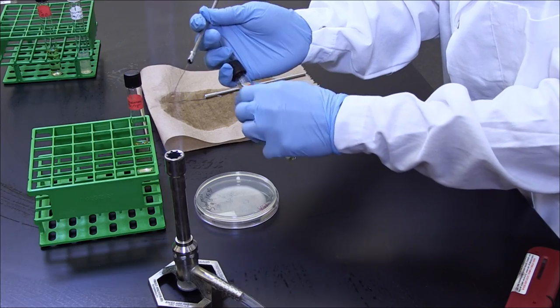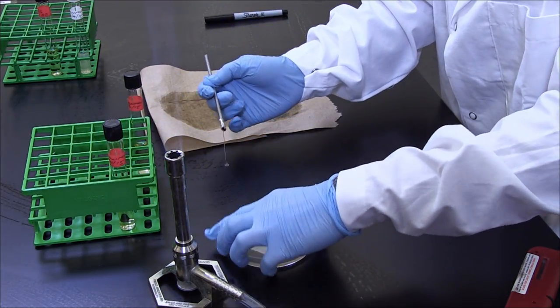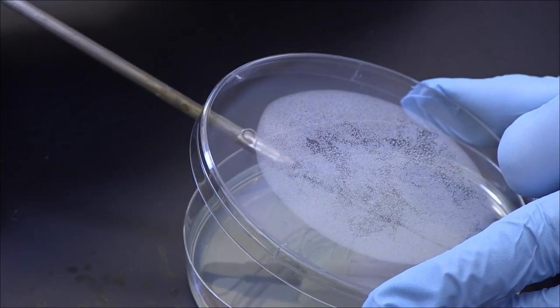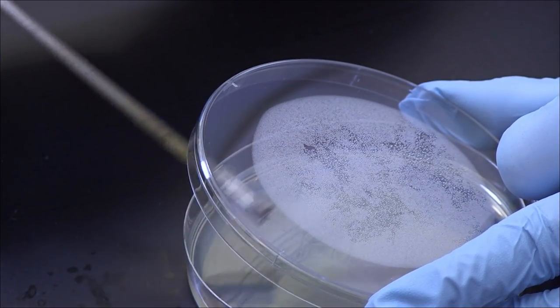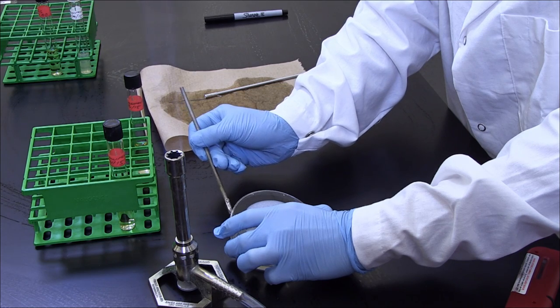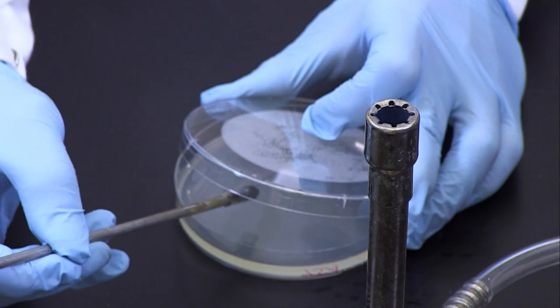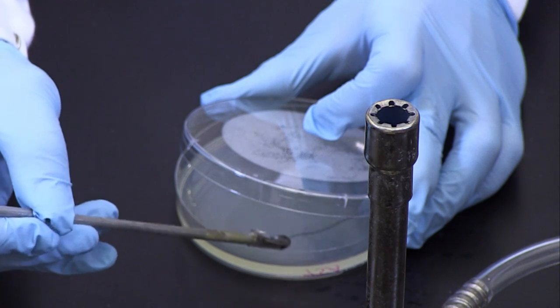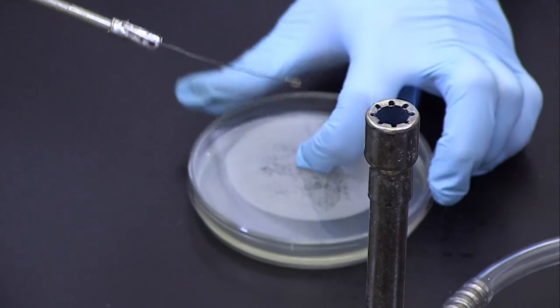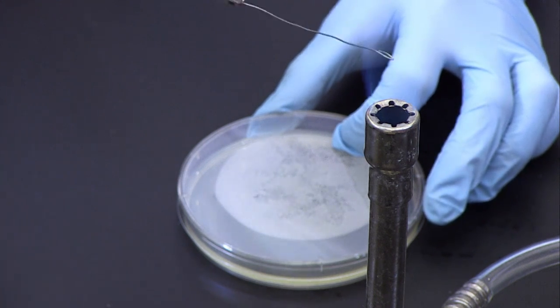Use your free hand to lift the lid of an agar plate at a 45-degree angle. Hold it over the base as a shield to prevent airborne contaminants. The bacteria from the inoculating tool is then streaked over the entire surface of the plate in all directions. Be sure to rotate the plate a quarter turn between streaks to ensure the bacteria is evenly placed across the plate.